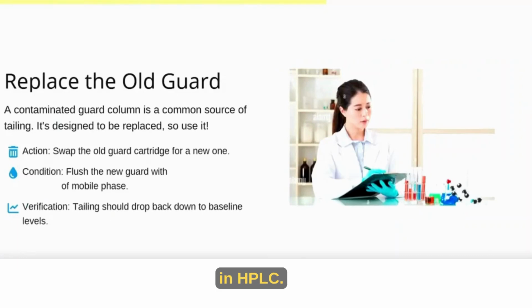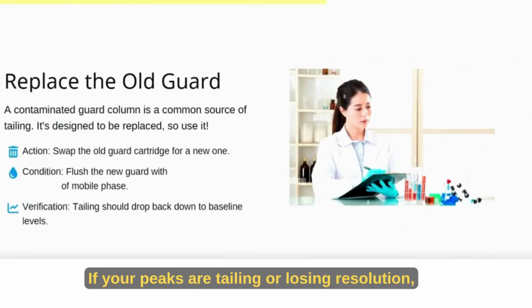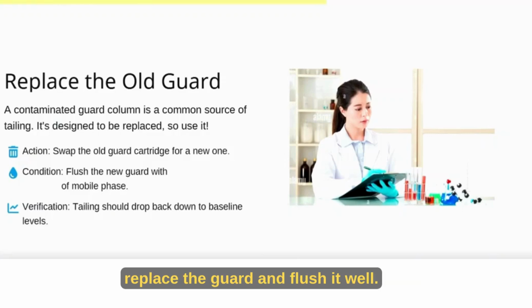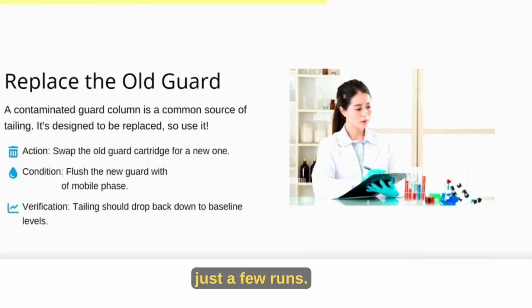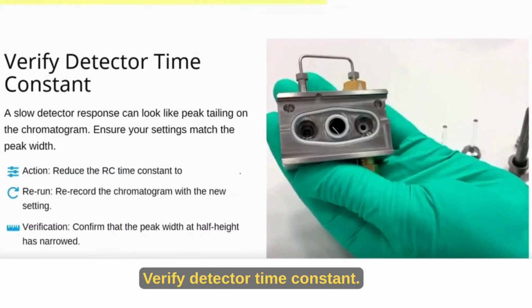Replace the old guard. A dirty guard column is one of the easiest fixes in HPLC. If your peaks are tailing or losing resolution, replace the guard and flush it well. You'll often see your performance return to normal in just a few runs.